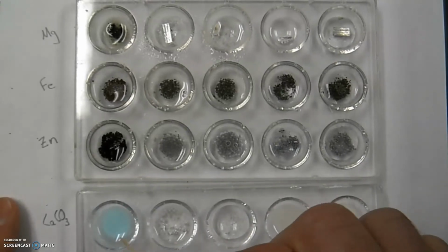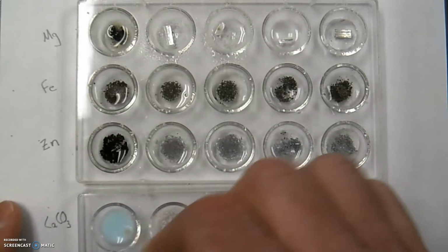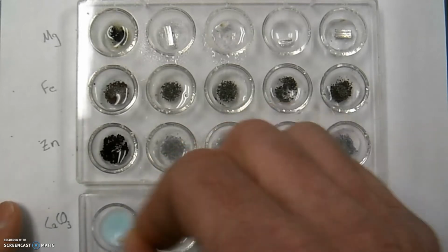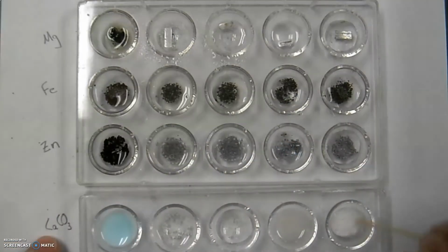And then this one over here, you did get a different precipitate, taking on that bluish color within there. And again, I could probably get that bluish color to go away if I were to balance this out a little bit more with the calcium carbonate. But again, over here, I don't really see anything exciting happening.